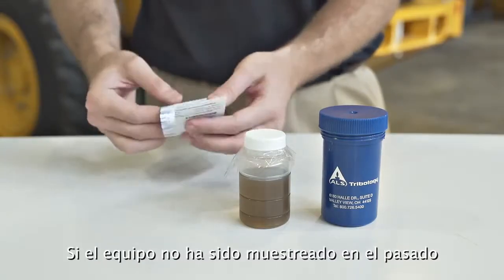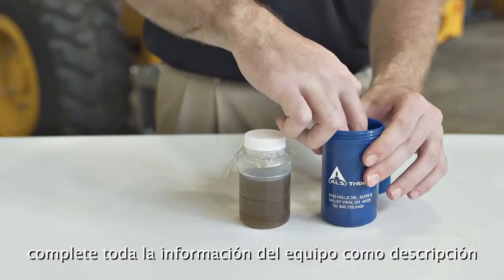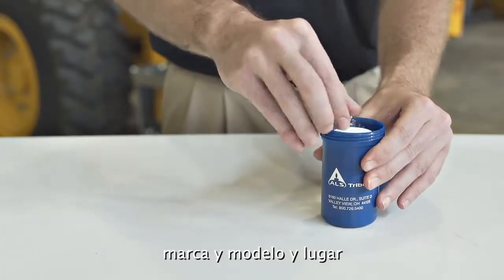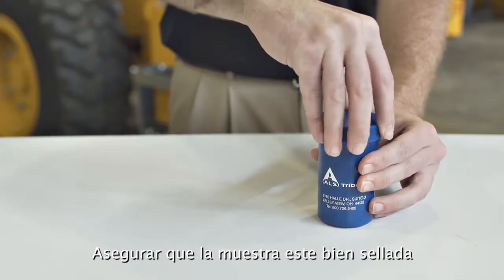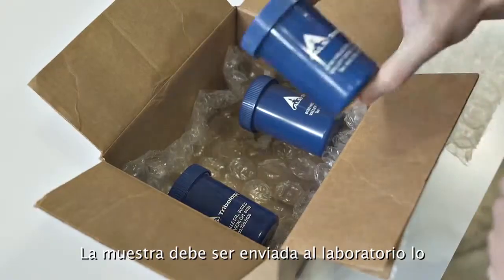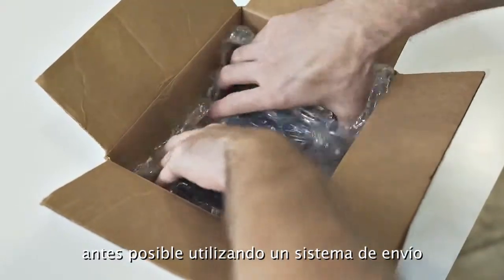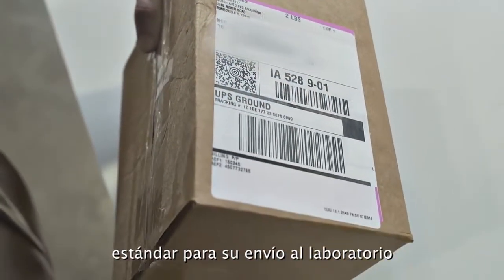If the equipment has not been sampled in the past, complete all equipment information such as description, make and model, and location. Ensure the sample is tightly sealed and there is enough sample to do all testing, but do not overfill the sample bottle. Samples should be sent to the testing laboratory as soon as possible using a reliable delivery method. Establish procedures for reliably sending samples to the testing laboratory.